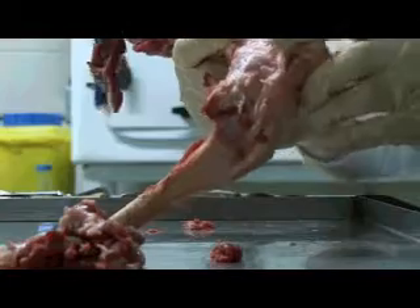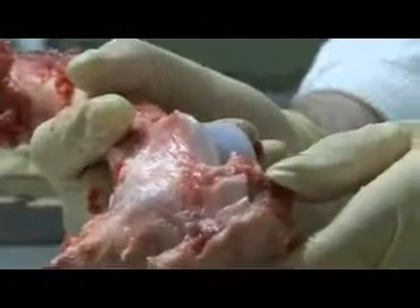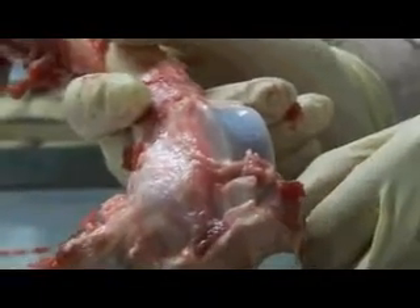So we're starting to open it up. That's the groove — that's the patella groove — and you can see just how wonderful that cartilage is. That's what healthy articular cartilage should look like. It's beautiful and white and shiny.